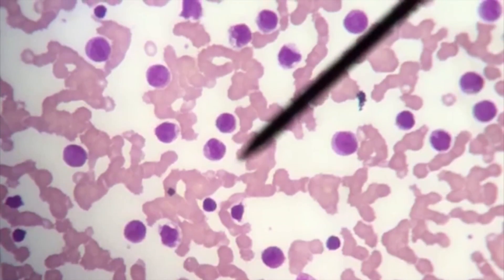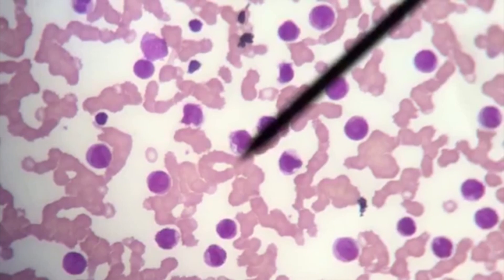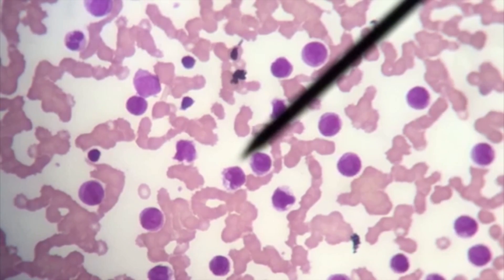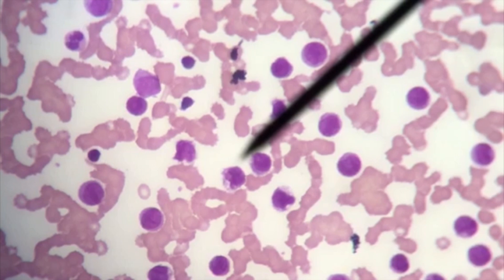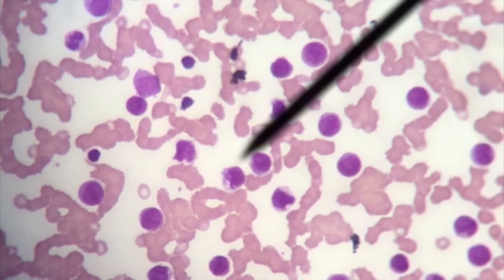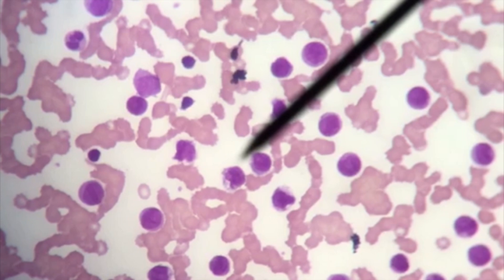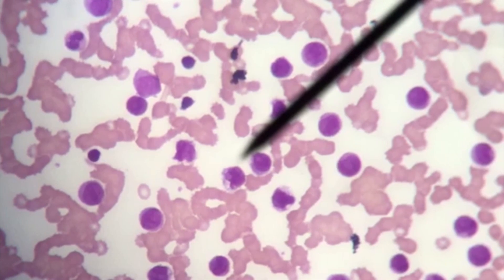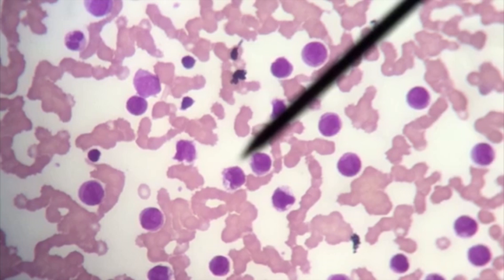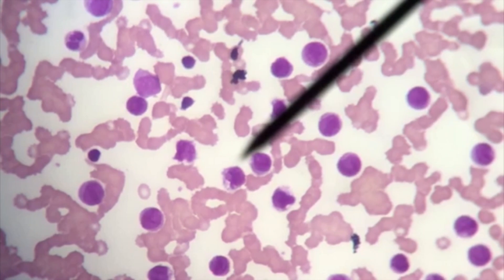Pro-monocytes have a very characteristic appearance. As you can see with the pointer, as we zoom in and look at the different monocytes, you can see that they have a nucleus with a delicate folding pattern — almost like a piece of tissue paper that has been crumpled up a little bit. This is one of the key indications of acute monocytic leukemia.